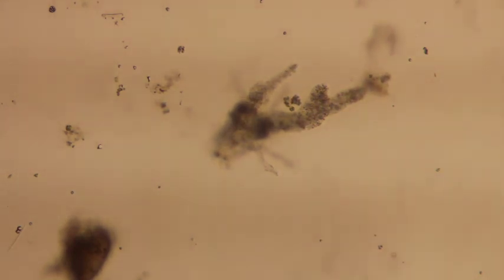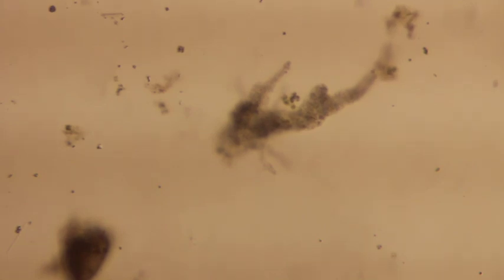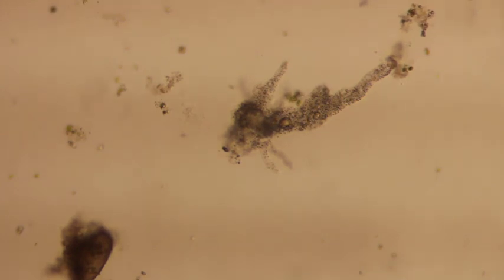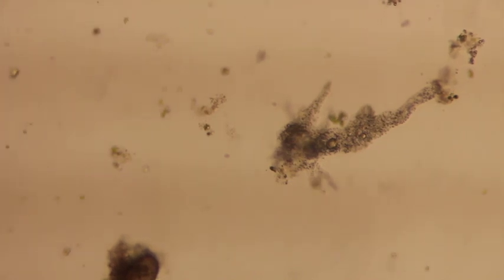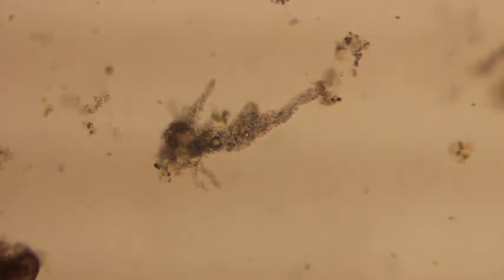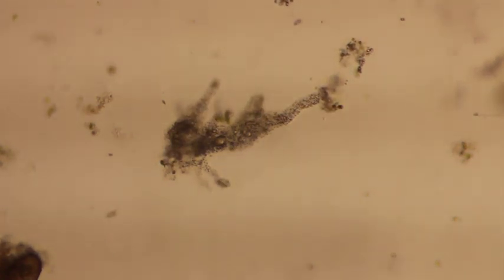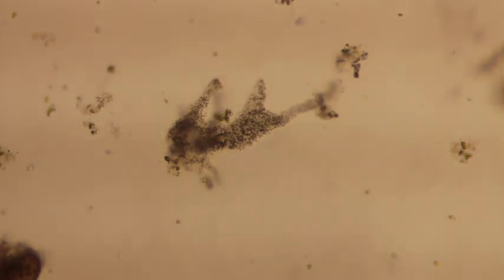You have your producers, which are photosynthesizers. You have your consumers, which are going to eat the producers. And just like in any ecosystem, we have our predators. These big giant amoebas are actually predators, even though they move extremely slowly. If you've ever seen the movie The Blob, the blob is a giant amoeba that goes in and eats people. So these amoebas are eating what are called euglena — all these little guys swimming around are euglena. The amoeba tries to trap a euglena inside its long legs, its pseudopodia, that it's moving around.